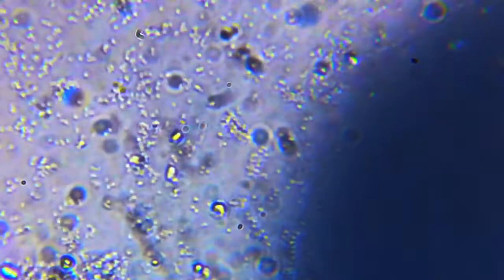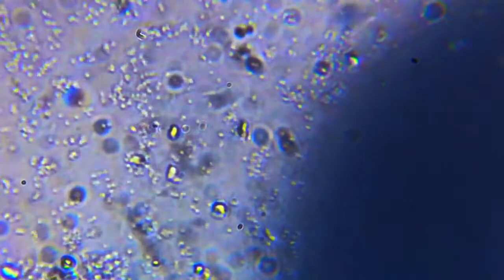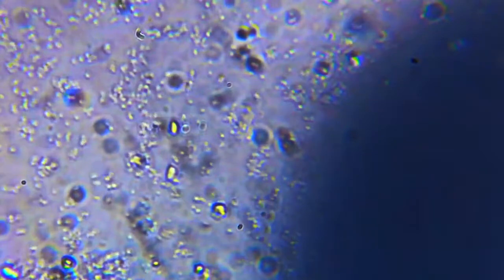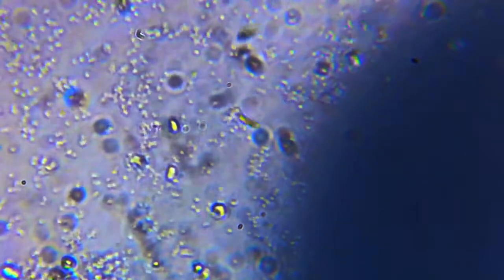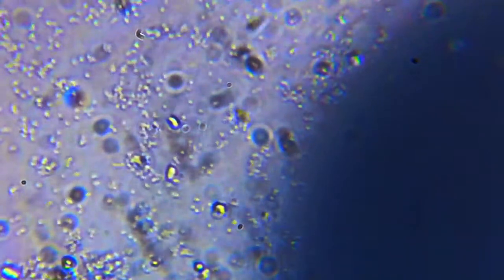Here are the same bacteria after I put a drop of alcohol. Notice how differently they move now — they are more stationary.